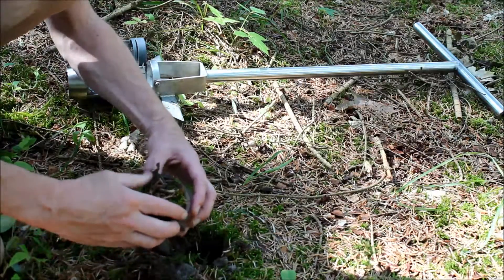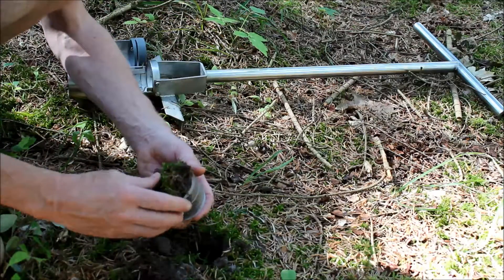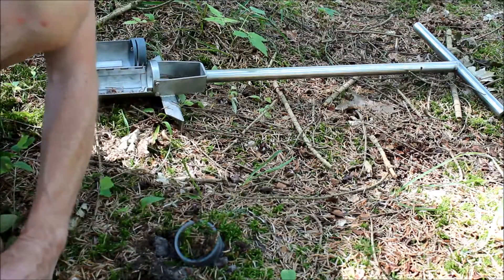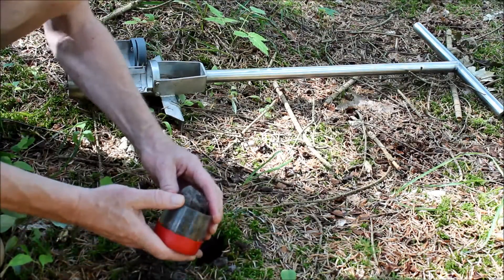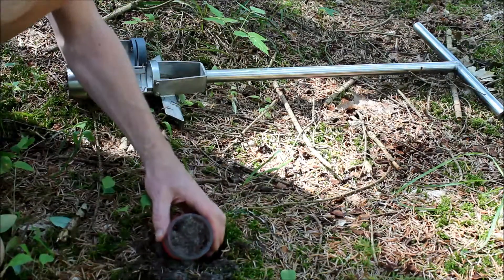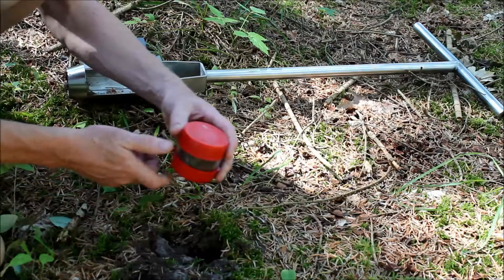Still, it's important to avoid compression, so you handle it very gently all the time. I can now put a top lid — now it's ready. And we have some extra soil here which I will cut off like this, and then put on the bottom lid. This is also an alternative way to do the sample.